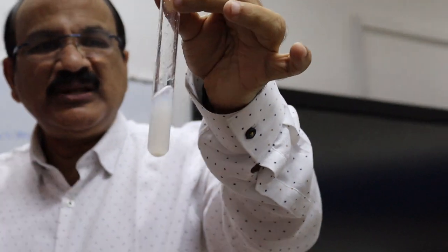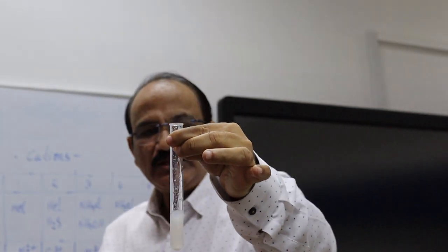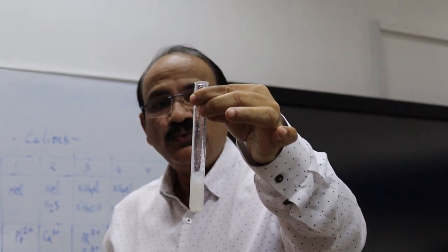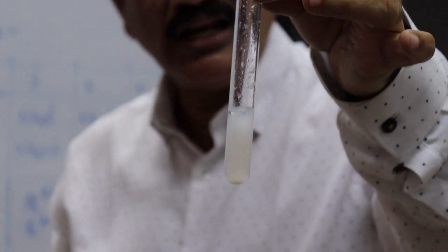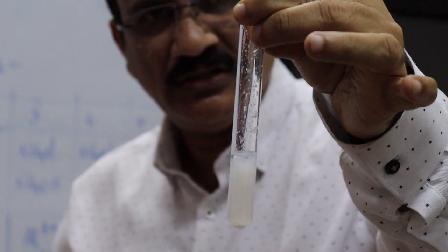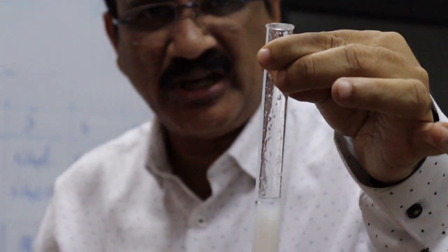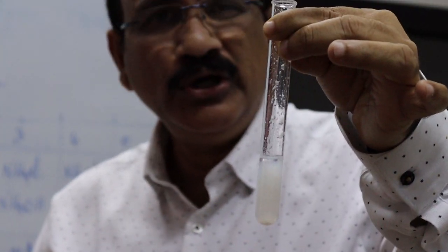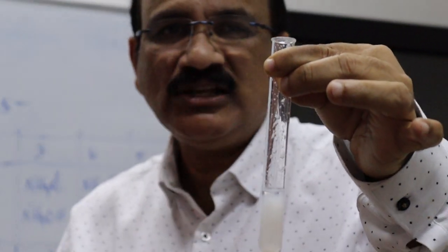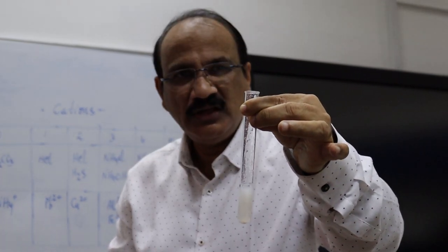We are getting a precipitate. It is a special type of precipitate. The precipitate is called white gelatinous — it is a gelatin-like precipitate. So we are getting a white gelatinous precipitate, which indicates the presence of group 3 as well as the presence of Al3+.